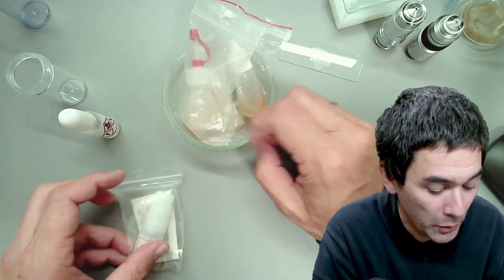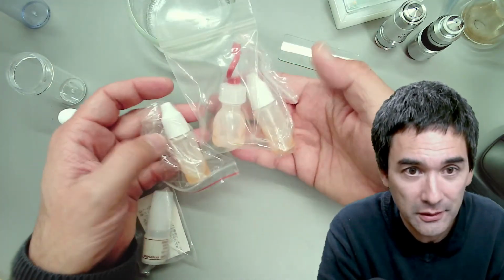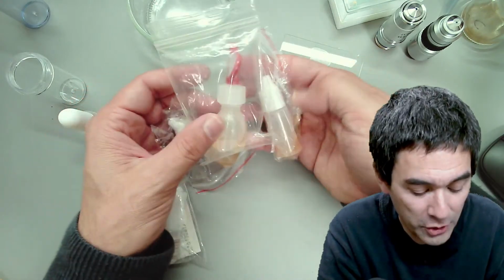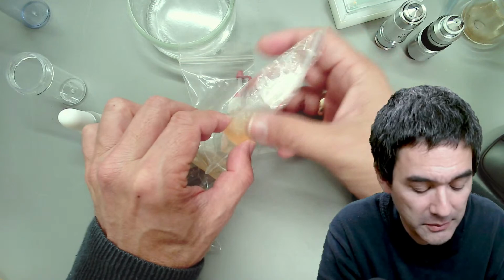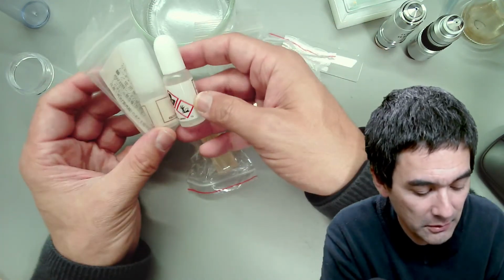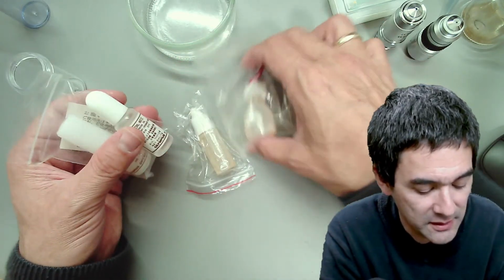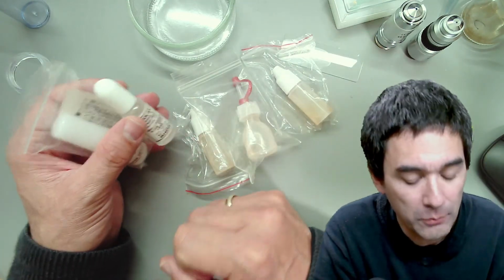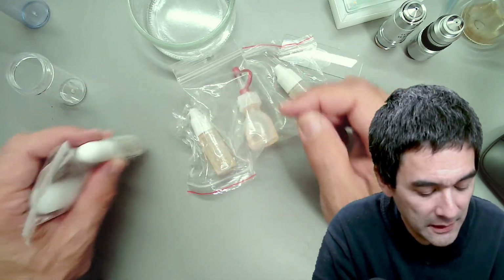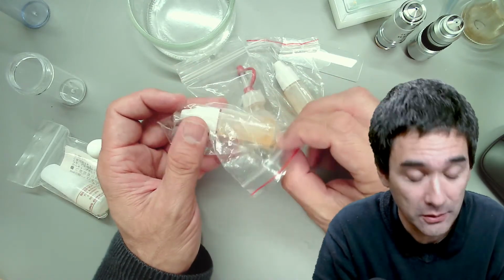I have got a few bottles here. Look what I've got here. I don't know if you're able to see this so well, but they look a little bit yellowish, right? This immersion oil looks a little bit yellowish. And then I have two bottles over here that look completely clear, white. So there's oil that's white, and oil that's yellowish. Now, there are two types of immersion oil. The clear ones are the synthetic immersion oils. And then there are what they call natural immersion oils, and they have a yellowish color.